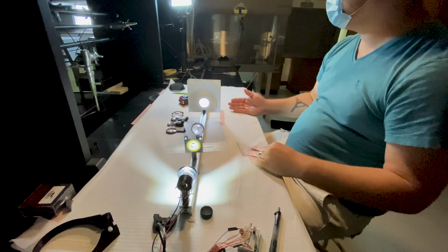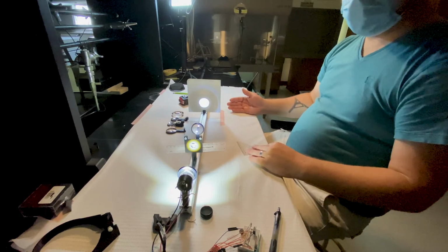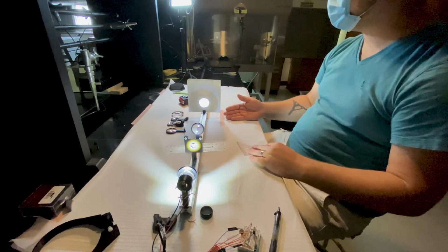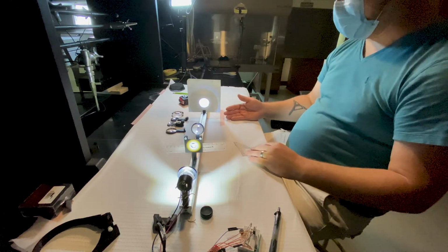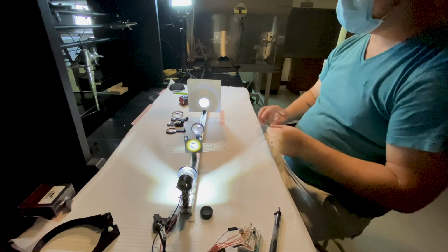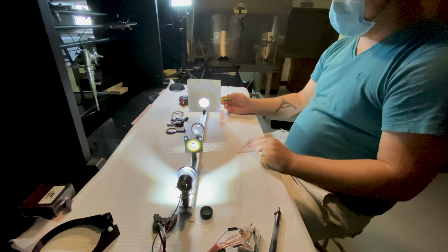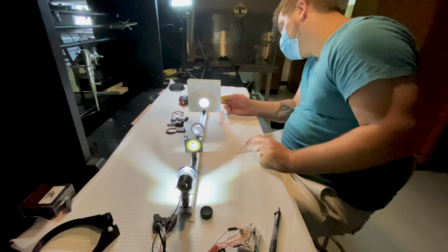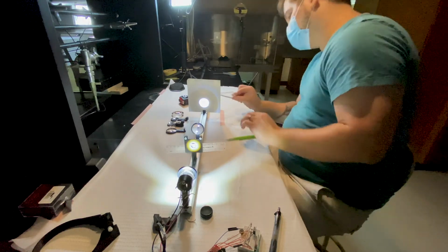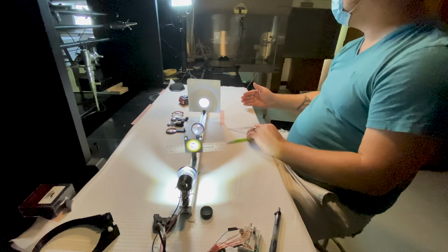And that's what we're going to be focusing on in our next lab: calibrating the magnification of your system. We do that by having these standards, where we know there is a particular distance between each of these gradations, and we can mark them on our paper and then measure them to calculate how much magnification we're getting.